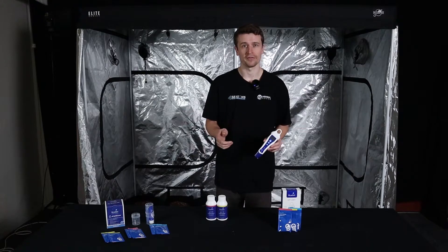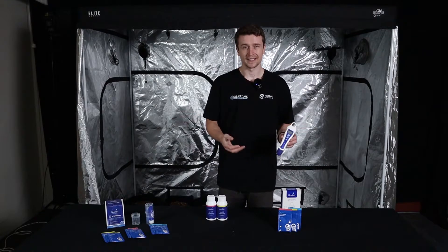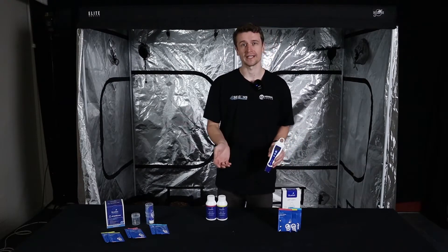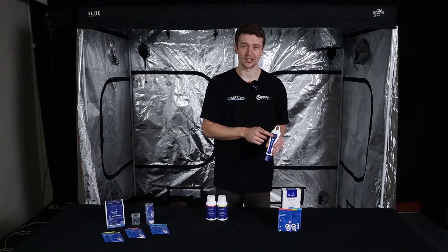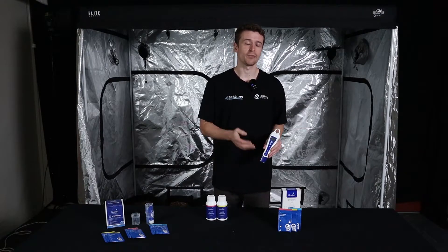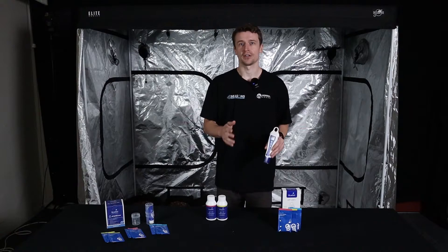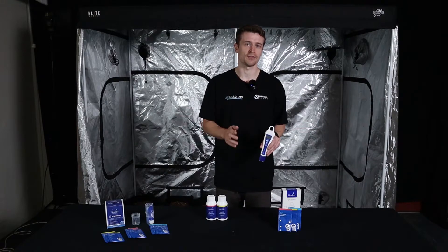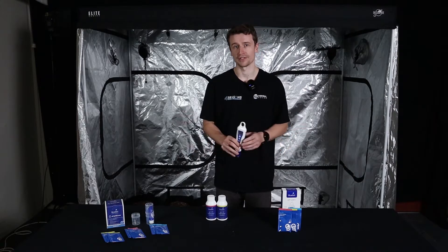Here at Herbal House we offer a pre-calibration option for the pen, which is easier for a lot of people. We pre-calibrate the pen and leave the sachets so you can recalibrate again later. There's a little tick icon on the display to indicate the pen is calibrated — when it disappears, it recommends recalibration. That's a 30-day timeout, mainly for commercial use to remind staff. For domestic use, it's not as necessary to calibrate that often.